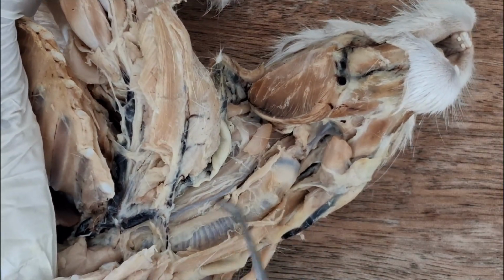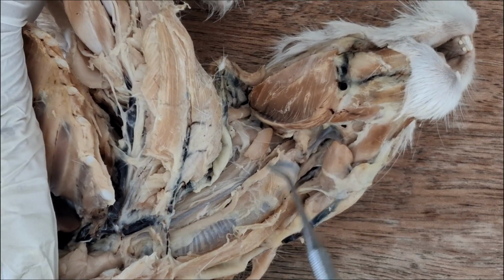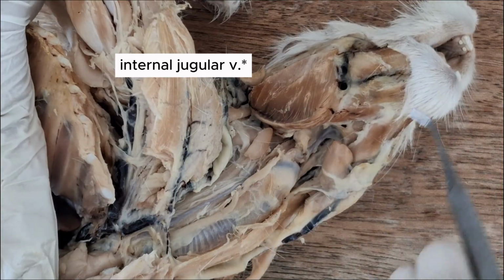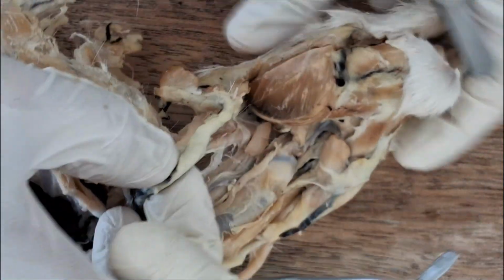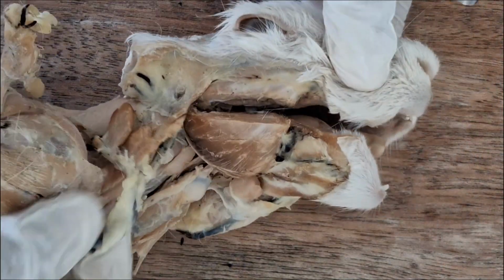The internal jugular cannot be seen anymore, but it also drains into the external jugular. You should find it along the sides of the trachea. There's a slender vein going upward to the brain, from the brain. The external jugular also drains superficial structures from the head.